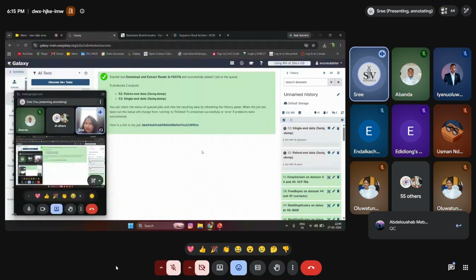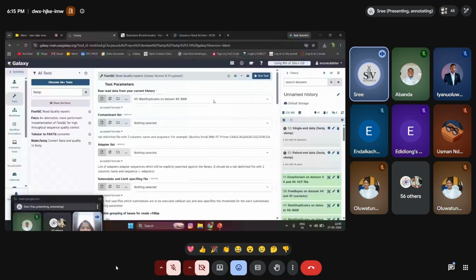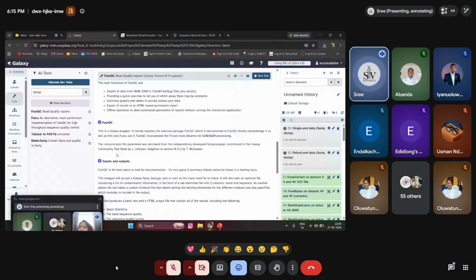In the tools, I search here. You can see the tool FastQC, a read quality reporter. If you select that, you can see information about the tool, parameters, and analysis: how the raw data looks, what the input data is, whether we have any adapters. All those things are highlighted. You can see the purpose of FastQC, why it is FastQC, how Galaxy wrapped it, what the version is. All of that is mentioned over here.